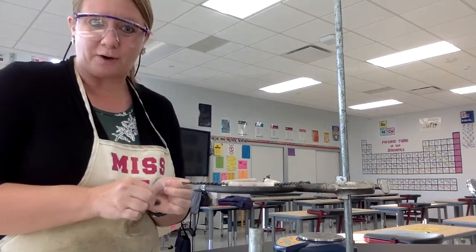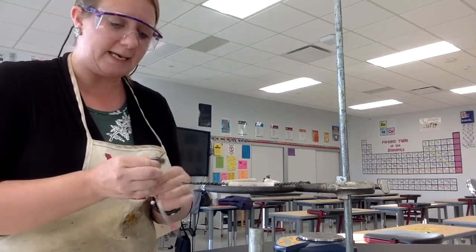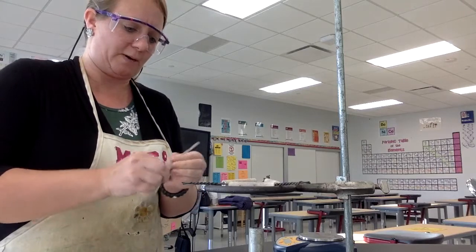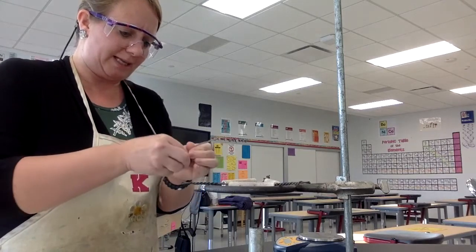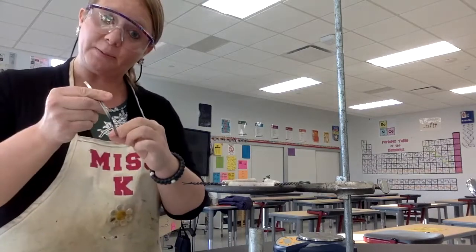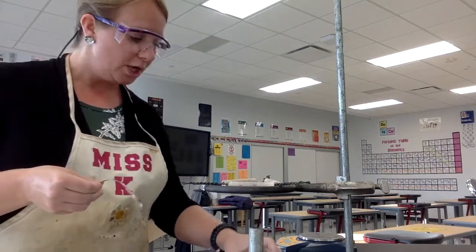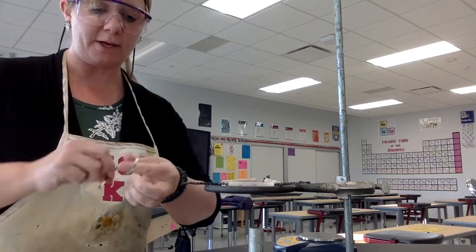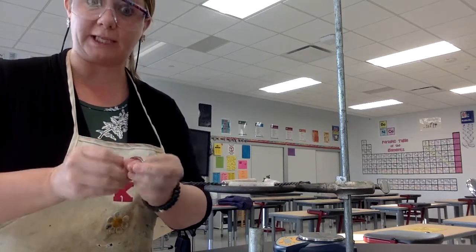I might not get it perfect because I'm going to have to actually touch it again, but this will kind of put it back to square one. So I'm just polishing it, getting anything off of it that I can. And then I'm going to make a flat coil so that this will fit inside my crucible. A coil, meaning like a spring, only it's flat.